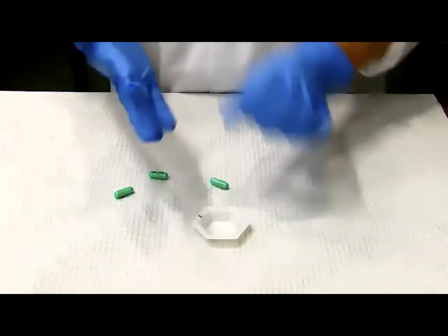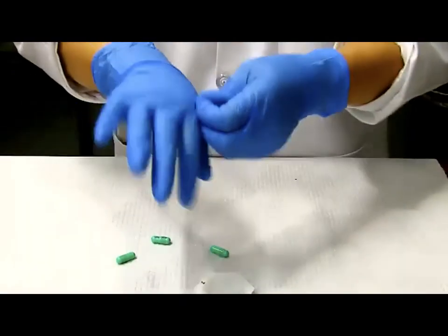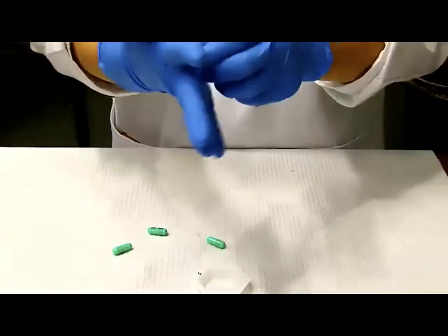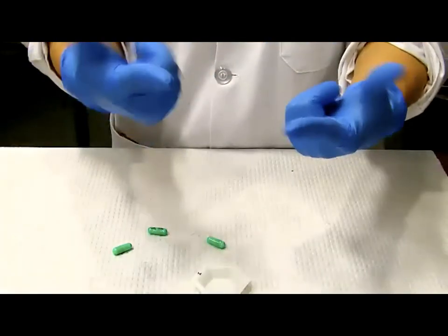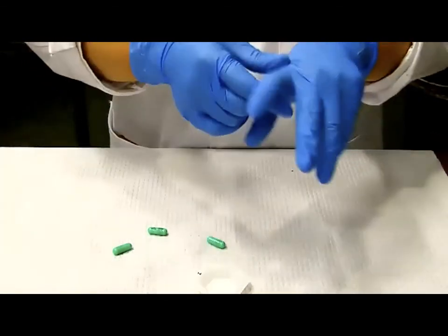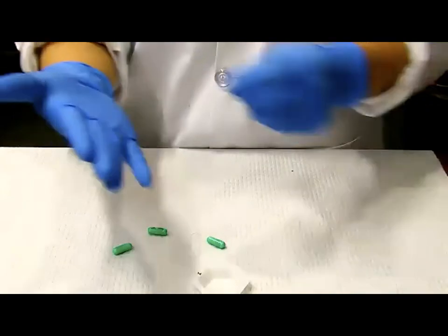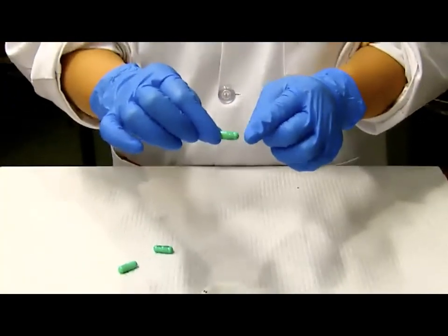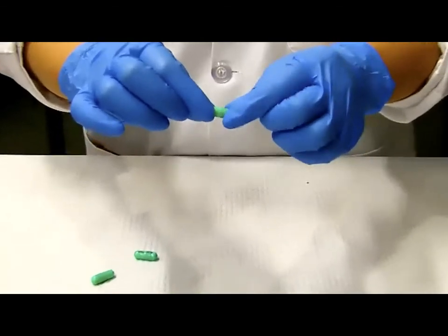So how do you open up a capsule? First of all, you want to make sure that your glove is very tightly fitting on your fingers, especially your thumb and index finger. You definitely do not want a loose glove. Indeed, if you have to, I would rather scale down, not scale up. All right, so the capsule has 2 parts, the shorter head and the longer body.